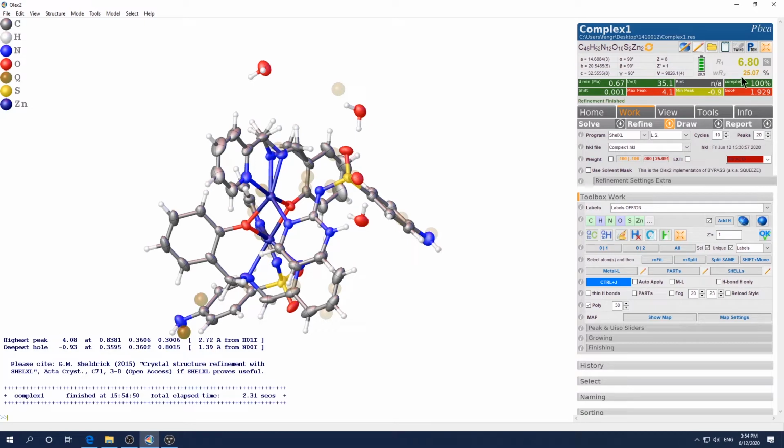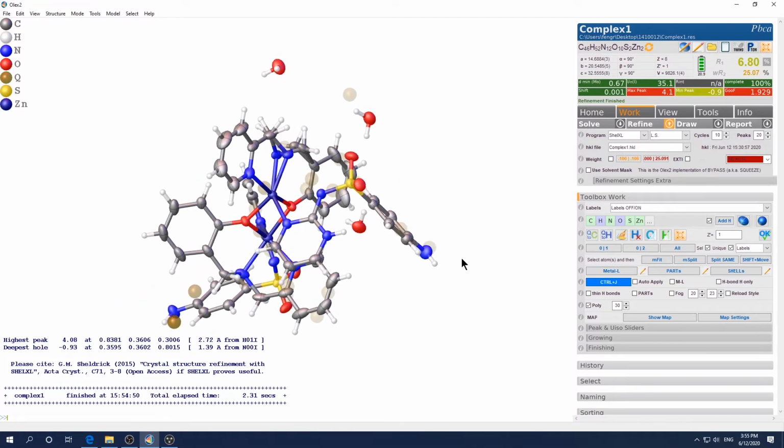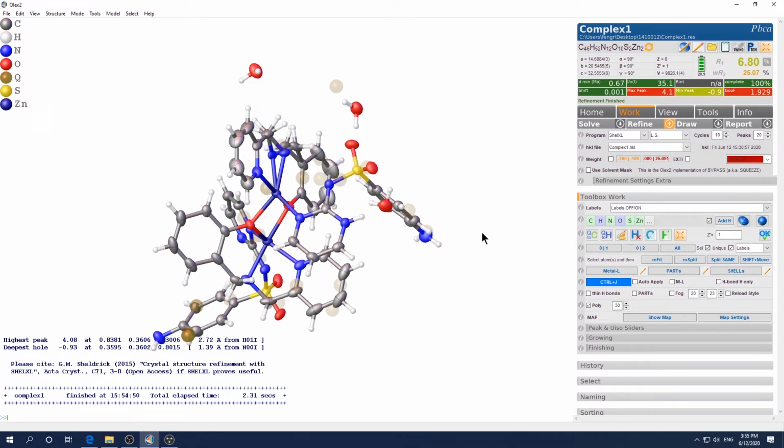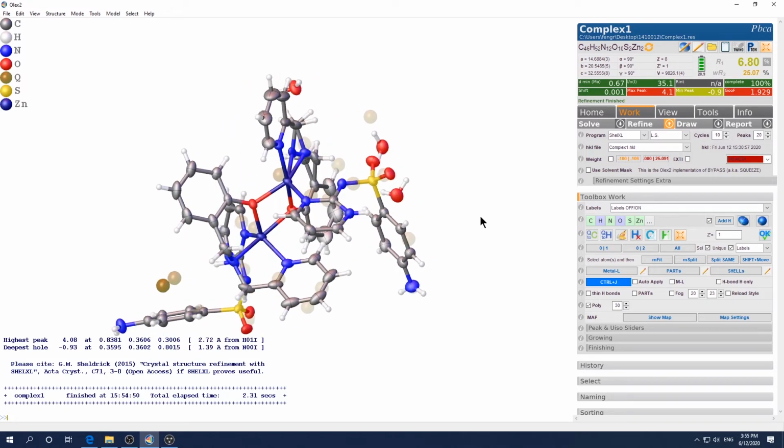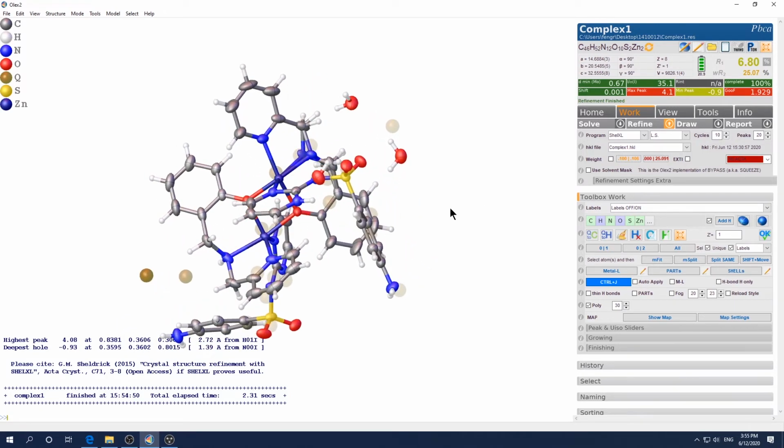And also this is another good example that you should not only look at the R value. Believe me, there are many ways to artificially lower the R value, but it's not the correct way to do it. Okay, so I have to stress this many times, especially for new beginners.